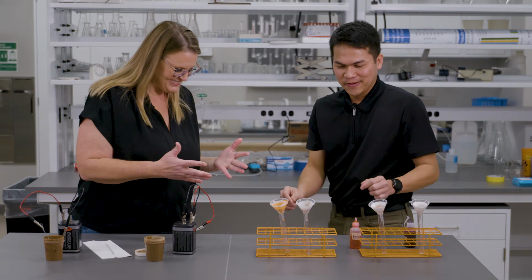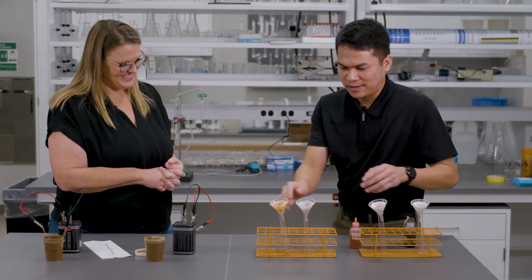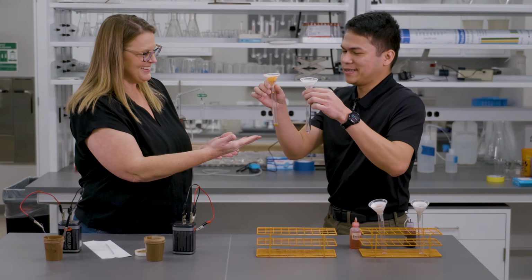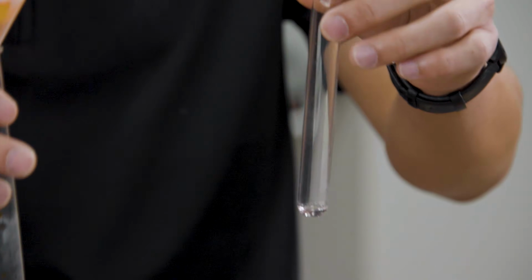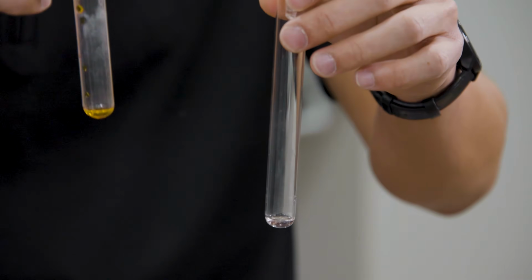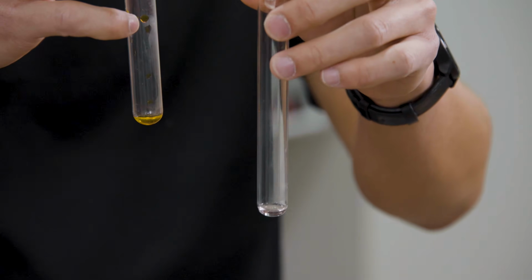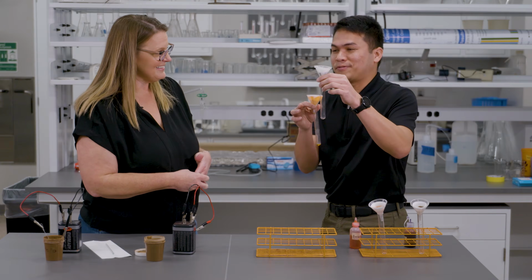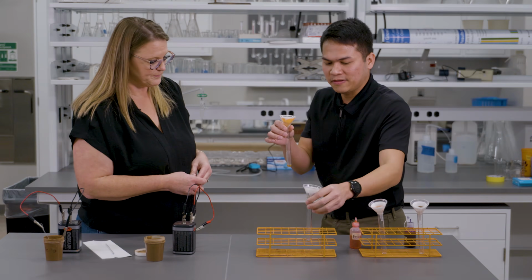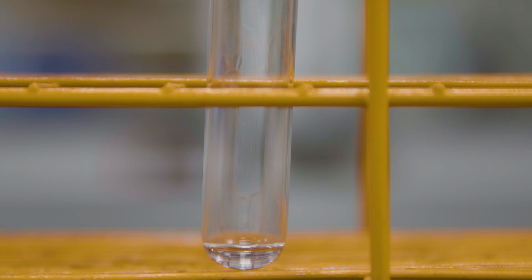All right. So at the end of this experiment, this is how it should look. Look at this one. This one has the purple dye, which bears positively charged ions. And look at the leachate. It's clear. It is clear, yeah. So it's saying that the net charge of the soil is really negative, so the positive dye actually stayed in that soil. Yep, the positive ions, or the cations, are attracted to the soil, making the leachate appear to be clear.